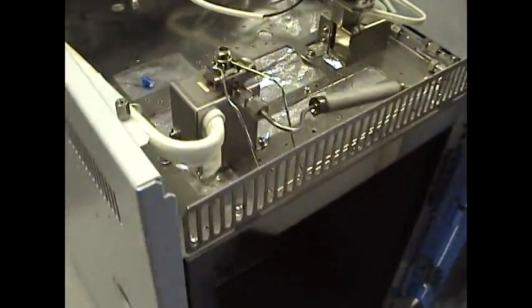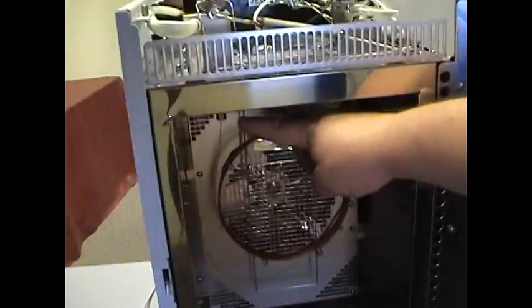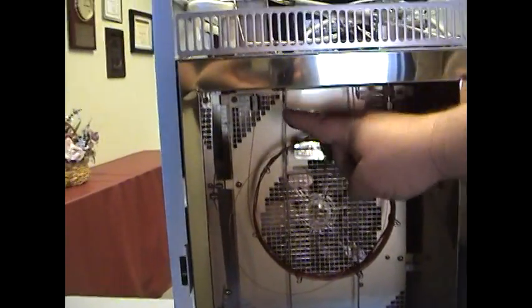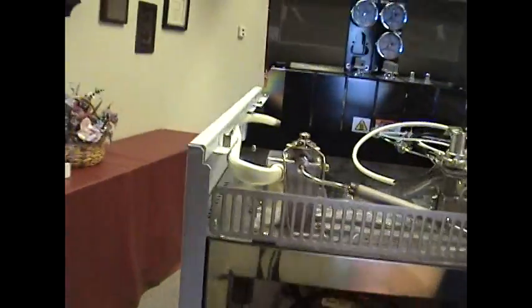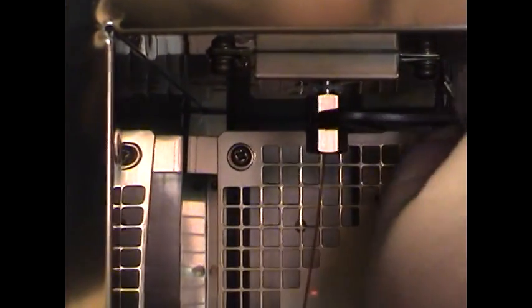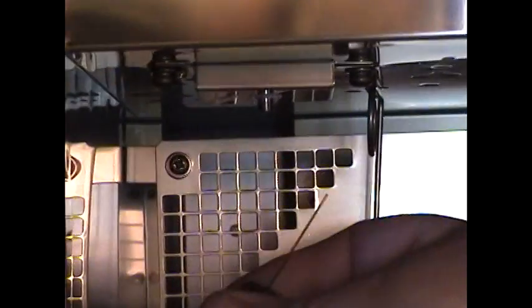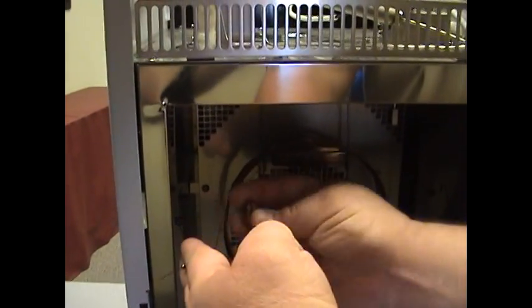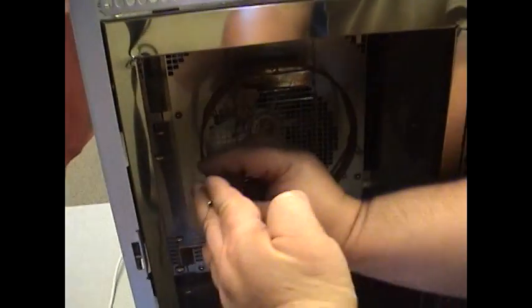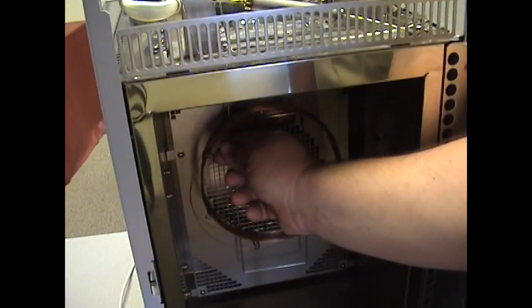Now, changing out the liner is also very much recommended to remove the injection port side of the column. This is located right here under the injection port. Simply take your wrench, loosen up. A couple turns, you can move it with your fingers. This nut has a slot in it, which allows it to fall through or come through on the column. Take the column out and just simply place that end in there.